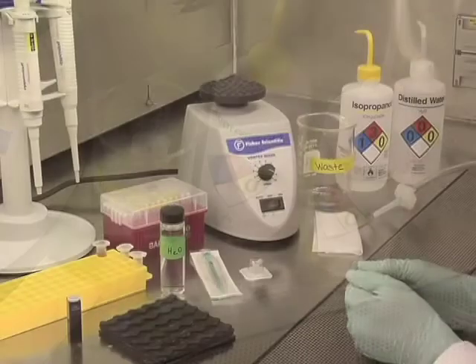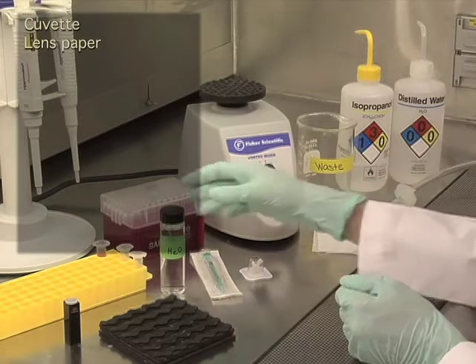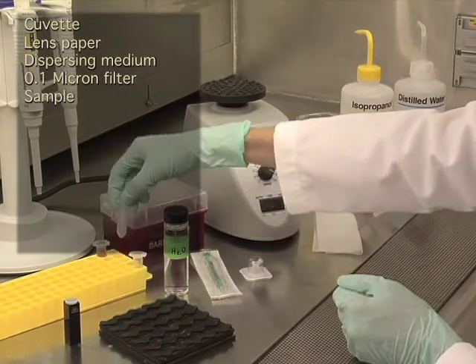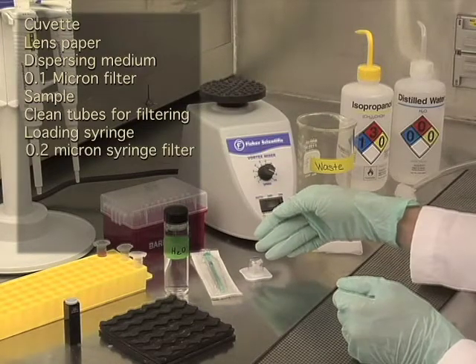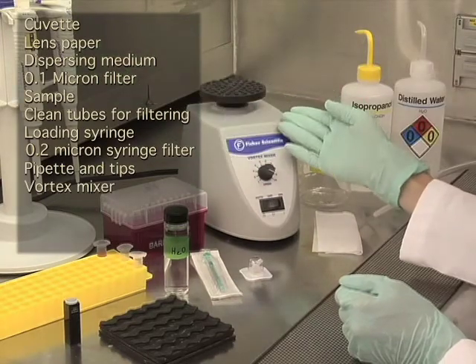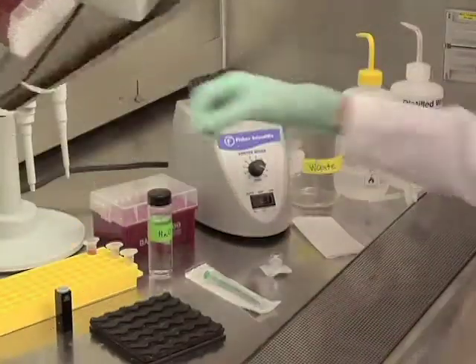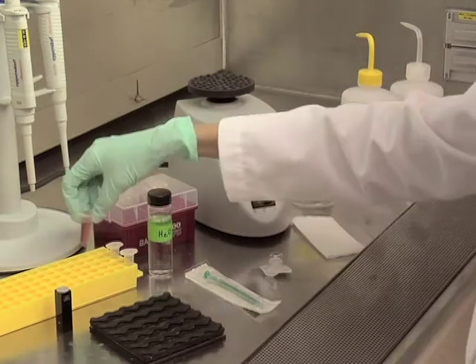Before we begin, you will need the following items: a cuvette and lens paper for wiping the outside of your cuvette. You will need your dispersant media, which needs to be filtered through a 0.1 micron filter or smaller, your sample, clean tubes for filtering your sample into, a loading syringe, and a 0.2 micron syringe filter. You will need the appropriate sized pipettes and tips, a vortexer for mixing your sample, and for cleaning the inside of your cuvette, you will need isopropanol, distilled water, and nitrogen gas. For this demonstration, we will be measuring 30 nanometer colloidal gold, which is a NIST reference material.